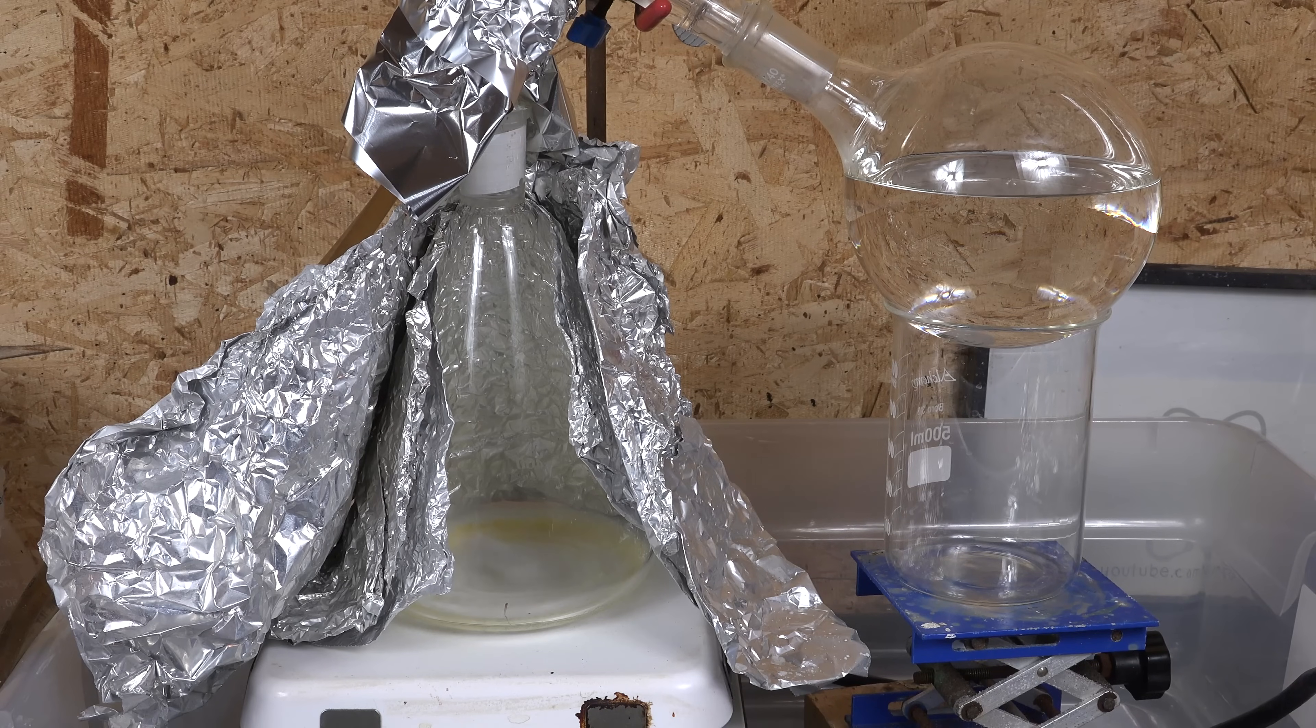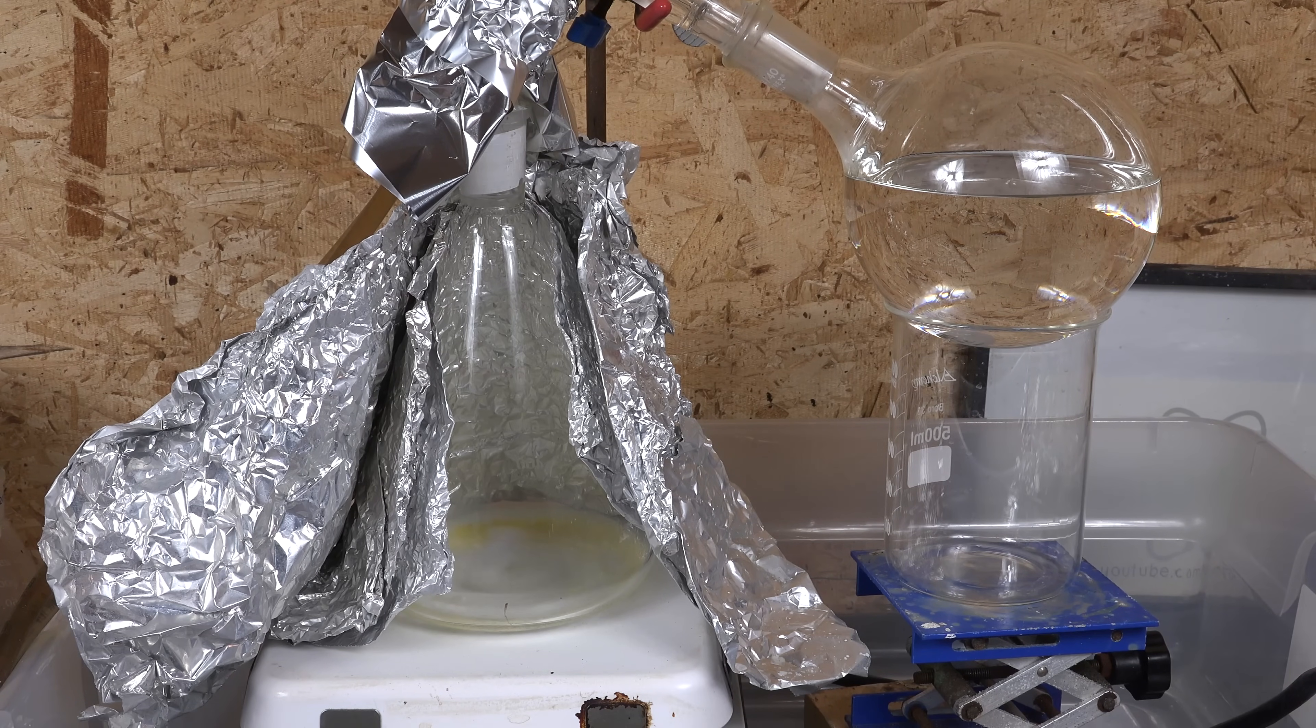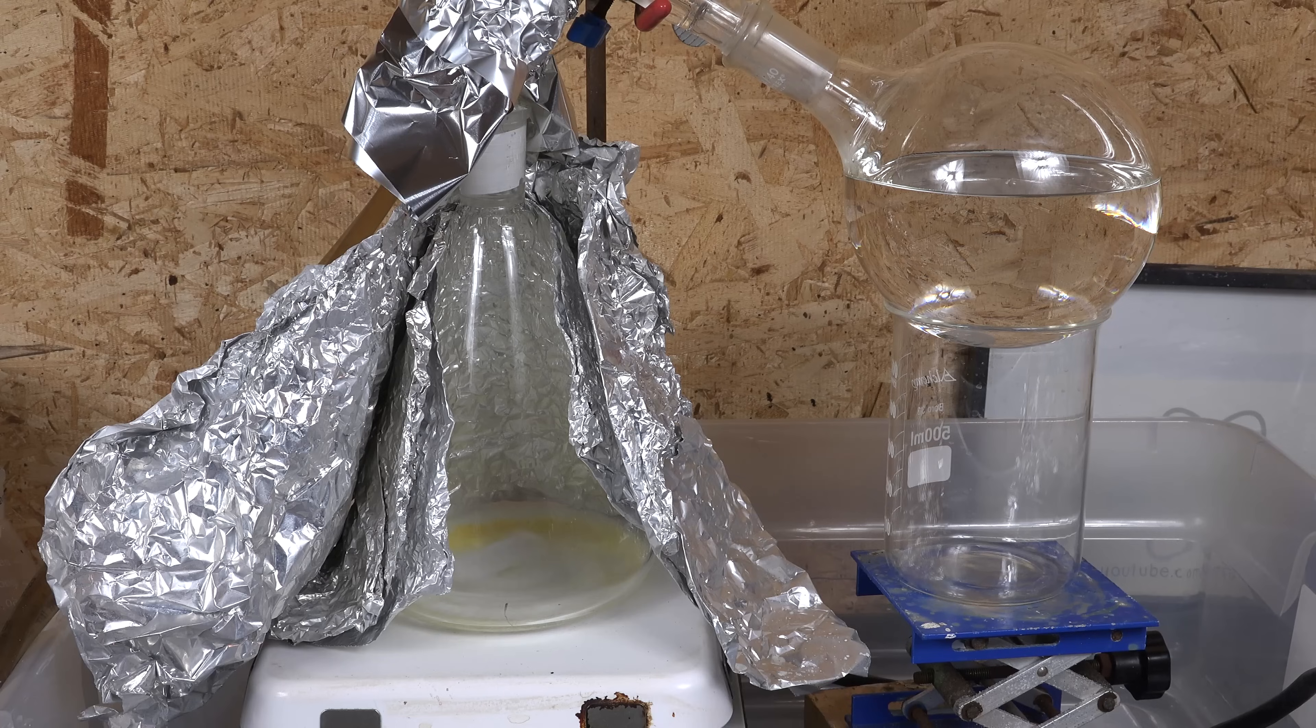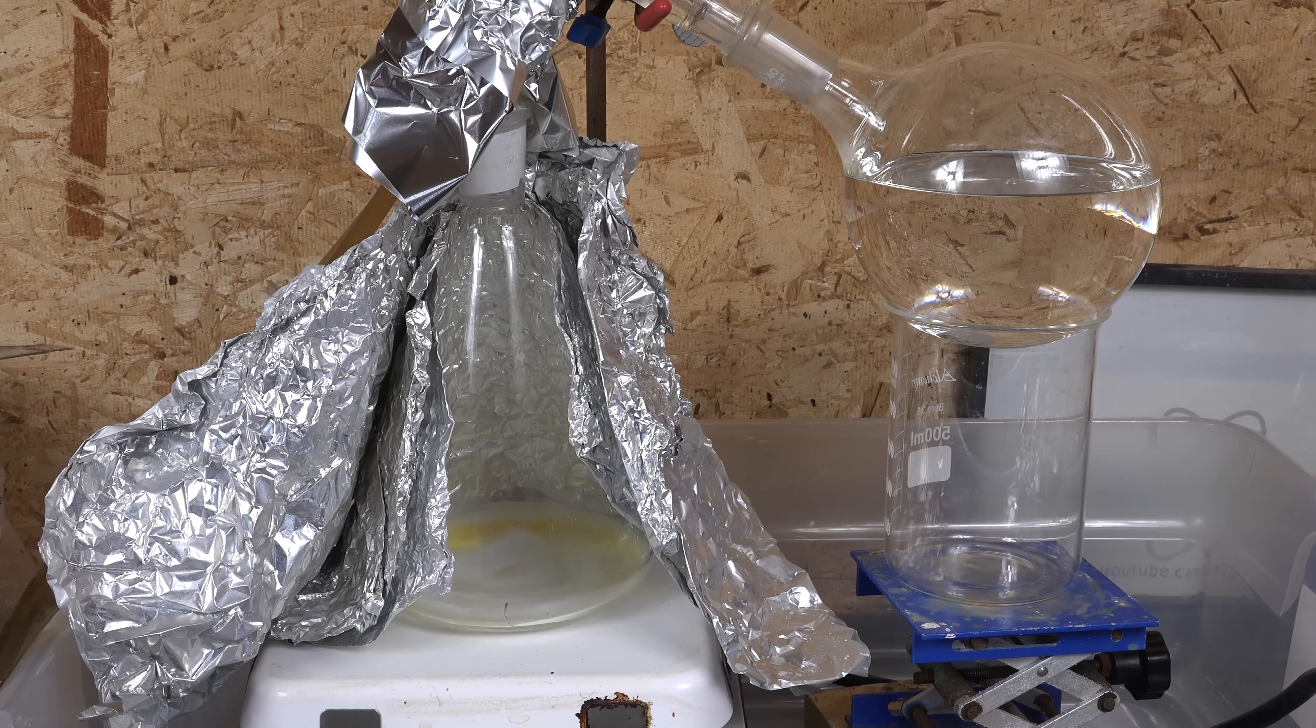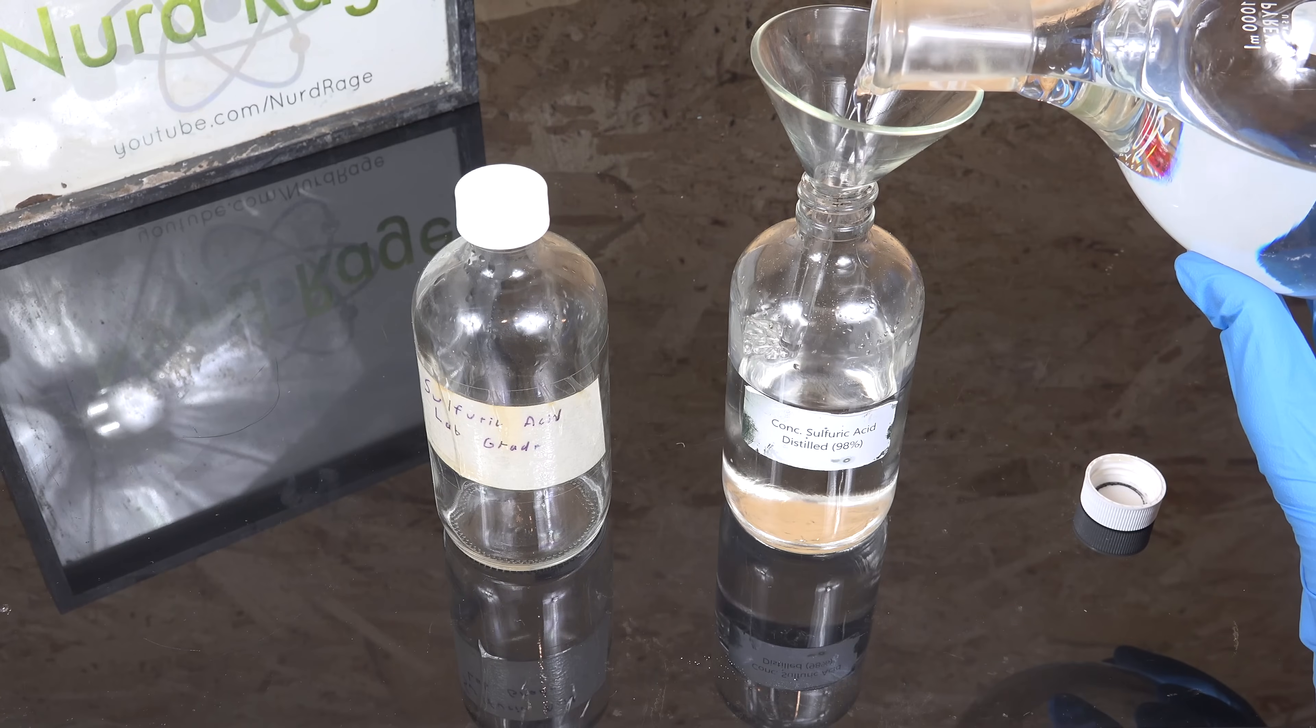And there we are, most of the sulfuric acid has been distilled over. The drain cleaner acid is relatively pure and has only a minor amount of salts that remain behind. Although I'm sure any existing organic impurities were completely destroyed.